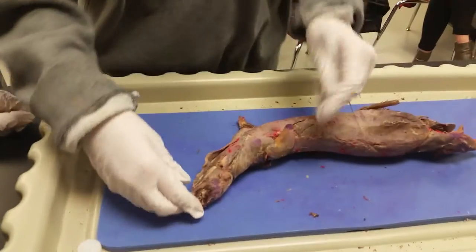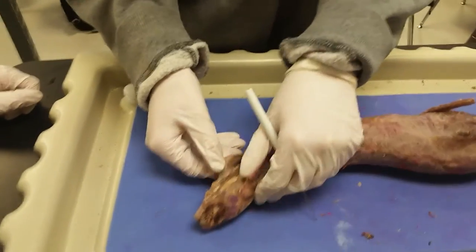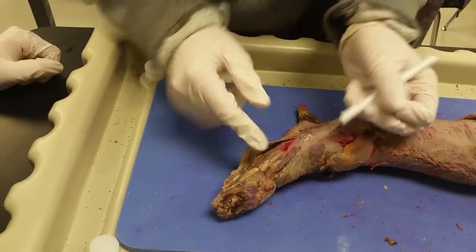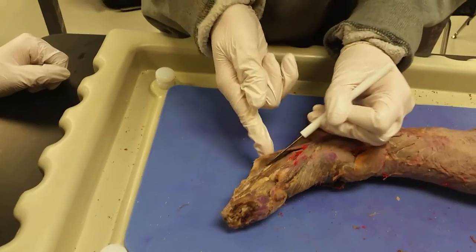101 with Dr. Meg. Today we'll be focusing on the neck muscles of the mink. First, we're going to start on the ventral side. As you can see, these two flaps right here are the sternomastoid.